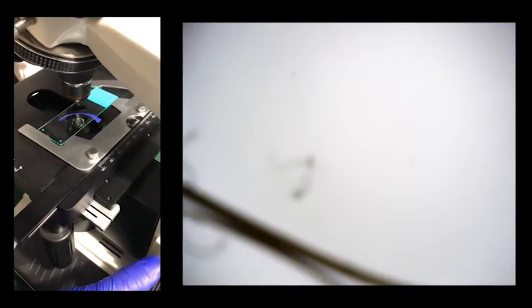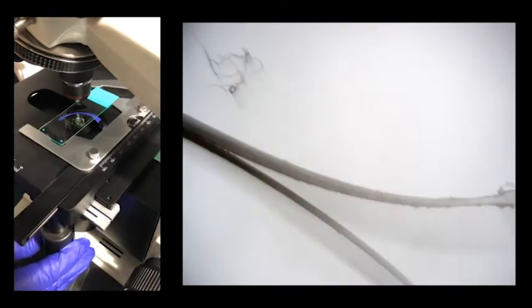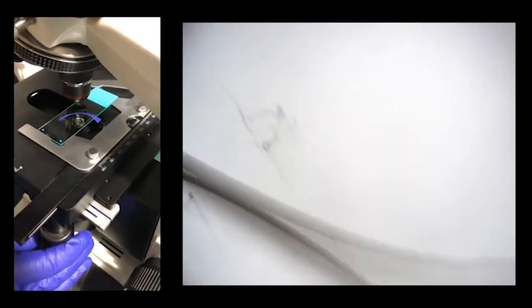All right, so we're going to start with sample one. We're just going to put it on our microscope stage and make sure it's centered over the light by moving the stage around a little bit. Now to really see our sample, we're going to start moving the stage up with the coarse adjustment knob—that's the big knob on the microscope—and we move it until we find the sample. There we go.